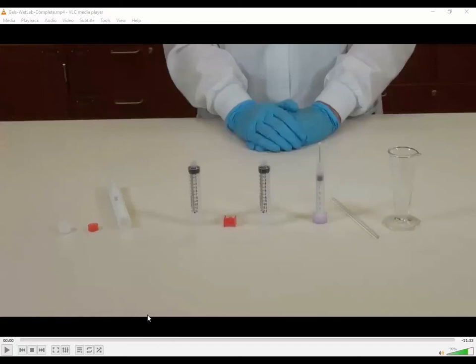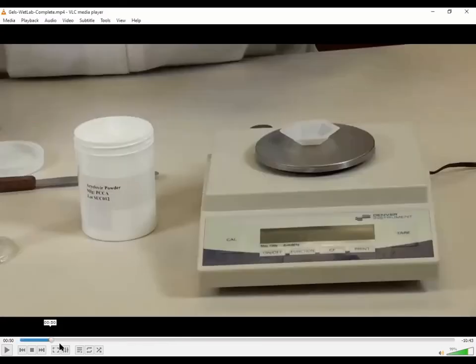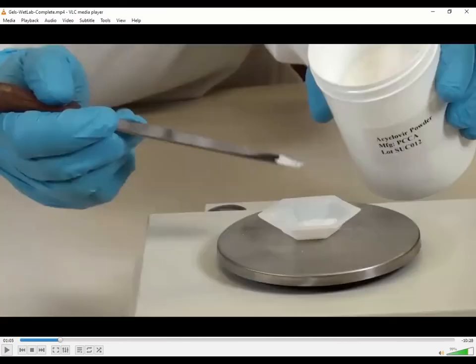Then we're going to have 2 syringes, and actually a total of 3 syringes. So let me explain first. The first thing you're going to need to do, to be honest with you, is weigh out some acyclovir powder. However, the acyclovir powder is just like the urea was. When you get it, it's going to be very crystalline and kind of granular, so you're going to want to grind it up, just like you did with the urea before. Again, you don't need a whole lot. 0.1 grams is not more than 1 or 2 scoops of your scoopula. So it's not a lot of powder.